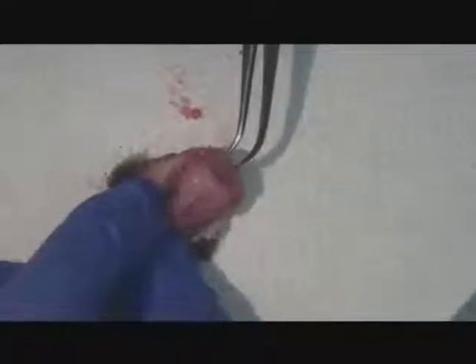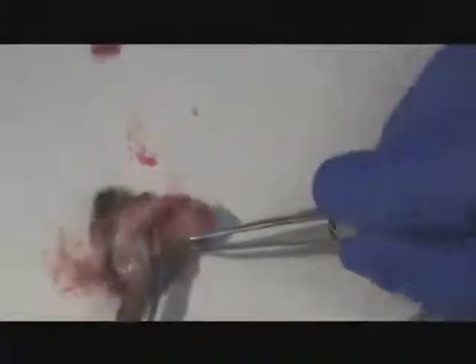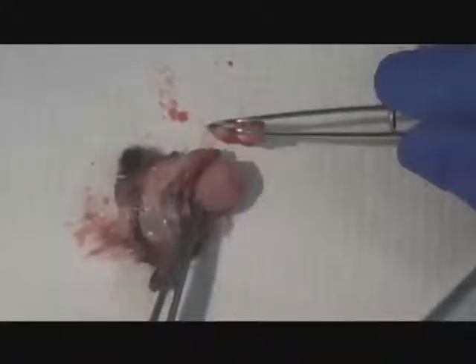Here I'm using the scissors to cut the right side of the skull flap, and after making the cuts, the skull cap can be lifted either from the back. And if that doesn't work, it can be lifted from the front — that's what's happening here.